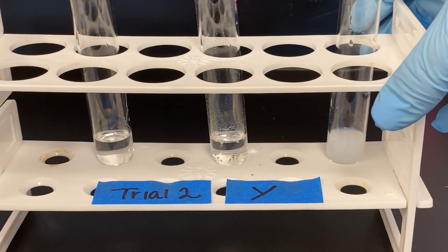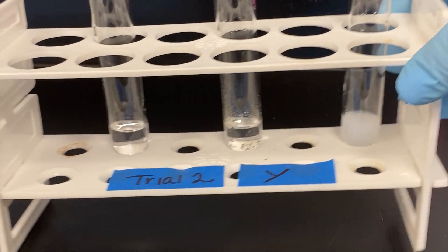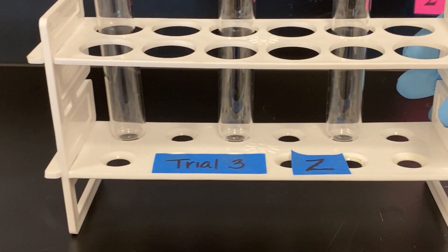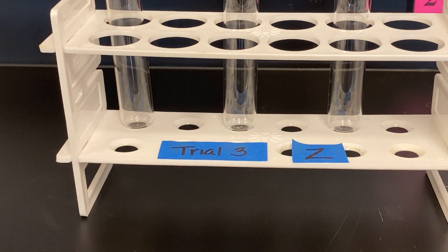Now that you have taken a moment to document those observations, we are going to start our third trial. For trial number three, we are using the Z-base solution.